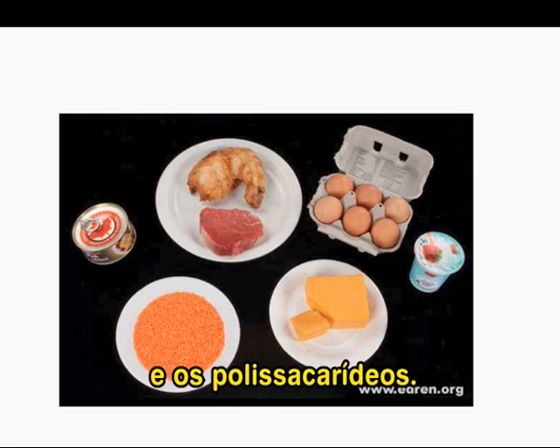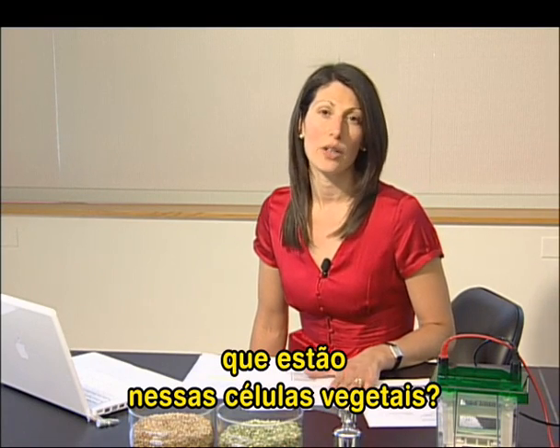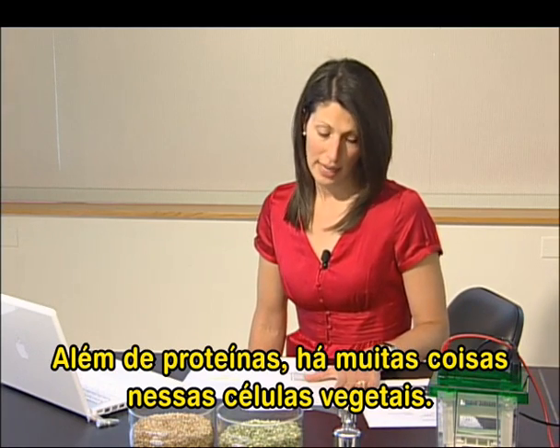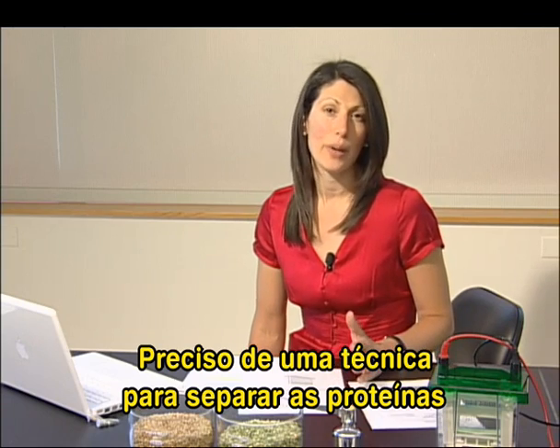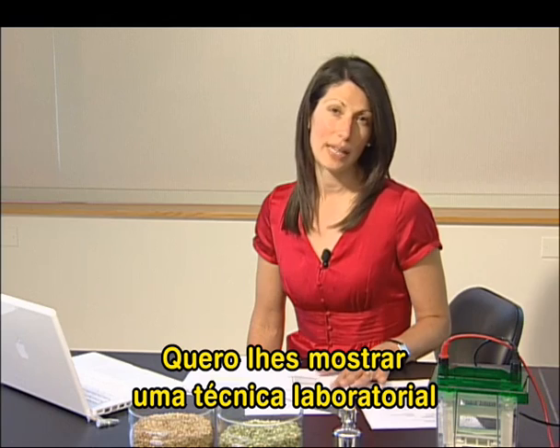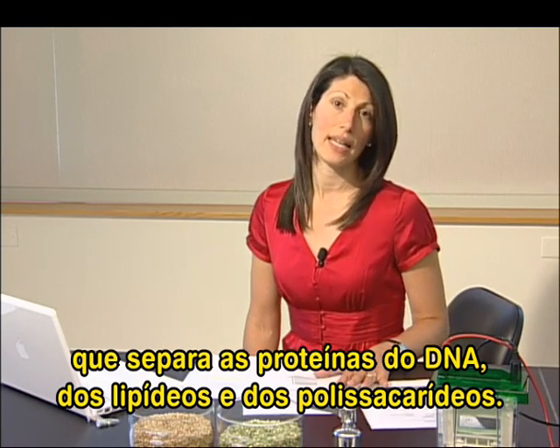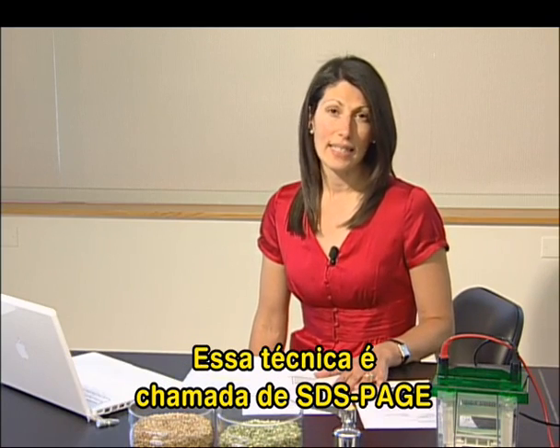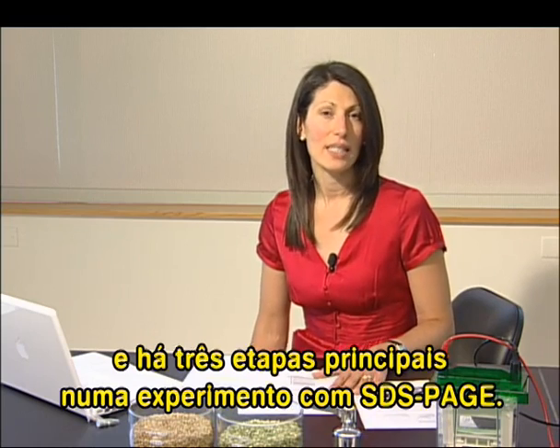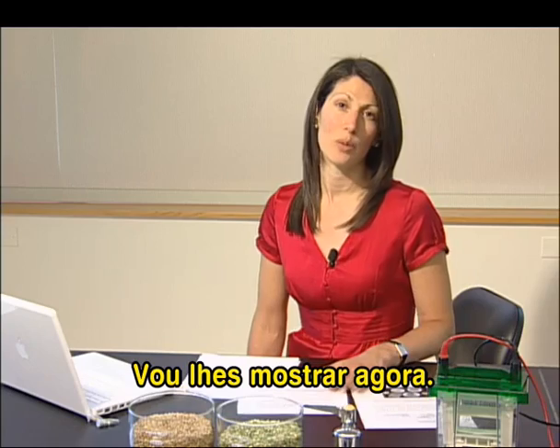So what if I wanted to study the proteins that are in those plant cells? There are not just proteins in those plant cells, but many other things. So I will need a technique to separate the proteins from the other components of the cell. What I'd like to show you next is a laboratory technique that separates proteins from DNA, lipids, and polysaccharides. That technique is called SDS-PAGE. It separates proteins based on their size, and there are three main stages to running an SDS-PAGE experiment.